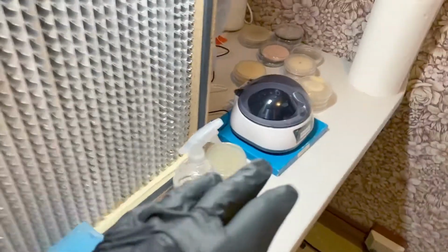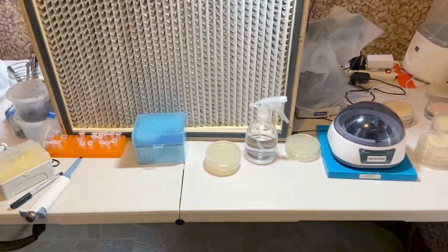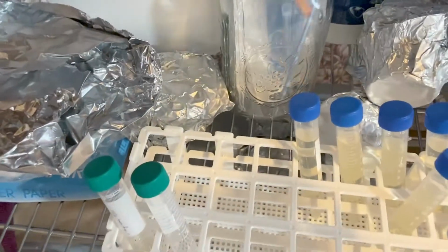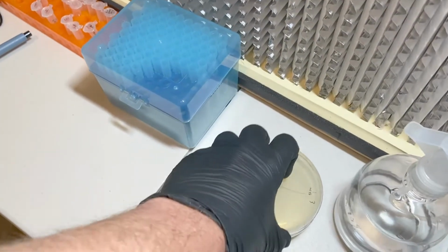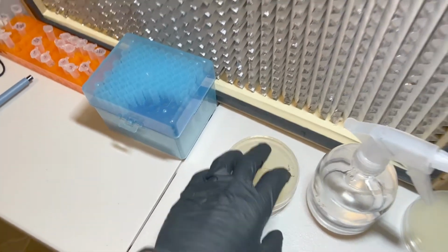I've never had anybody teach me any of this stuff. Everything that I'm doing, I've learned just by reading and watching YouTube. And I'll be honest with you, I can't remember the last time I watched a YouTube video on how to do proper plate spreading. I know that I use this little tool right here to spread things across the plate. But I know there are other ways of spreading stuff on plates. They have beads. You can put the beads in the plate and swish them around, and the beads will evenly distribute whatever it is that you want to put on the plate.